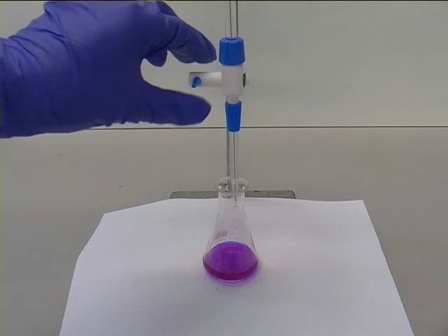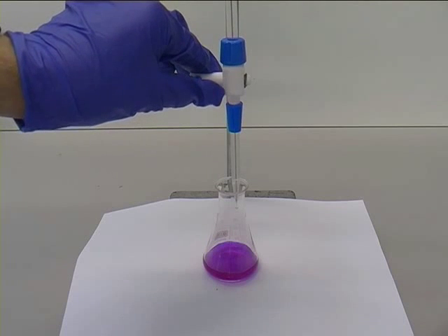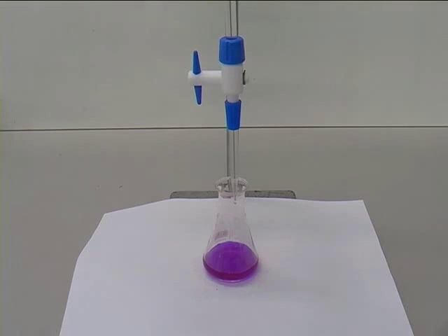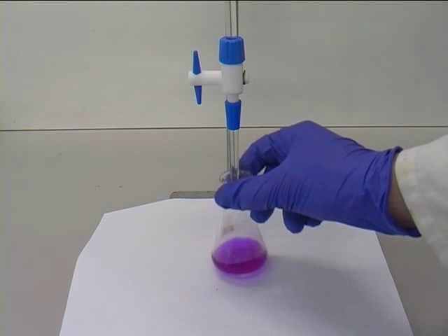Now you perform a rough test run or range finder. This is roughly titrating the stock solution against your unknown solution sample. Ensure that you swirl the sample at all times.